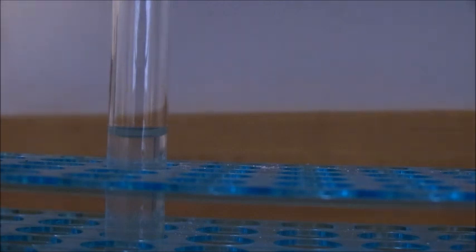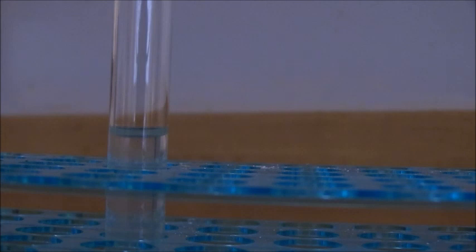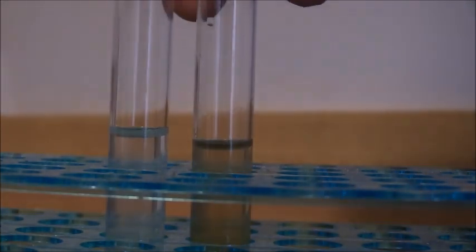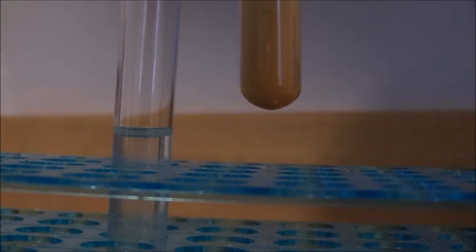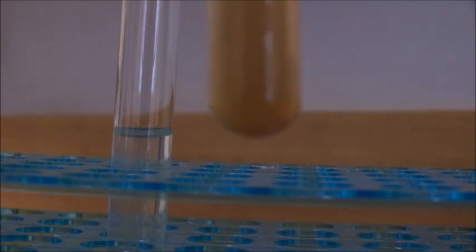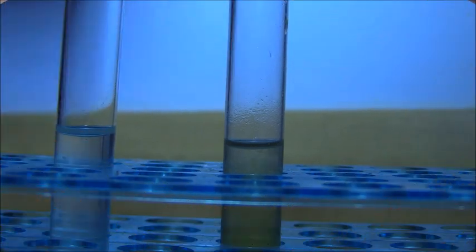And so now see if we have a brown precipitate. Well, there looks like there's something that's settling out at the bottom there. So we'll just let this sit a few minutes and we'll come back and see if we have a brown precipitate.